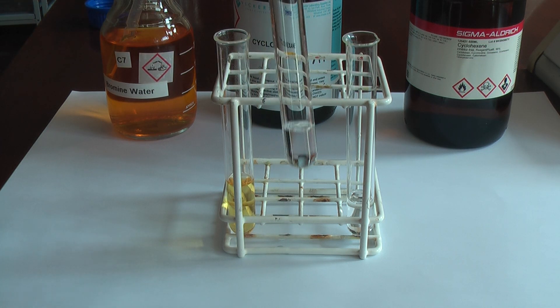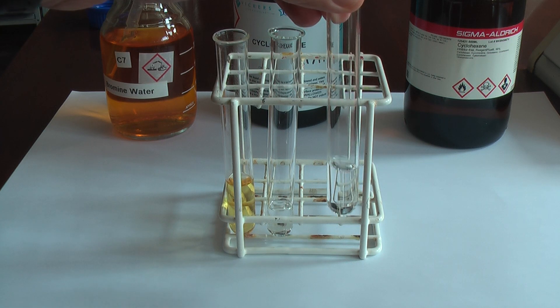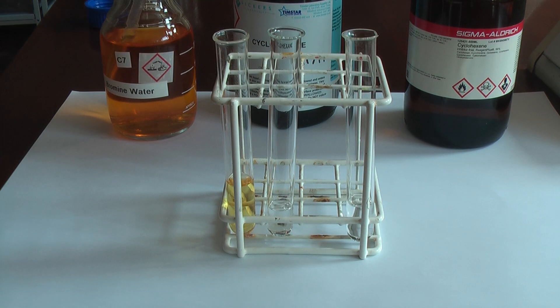This is the cyclohexane, which is completely colorless, and then over here I have the cyclohexene, which is also colorless.